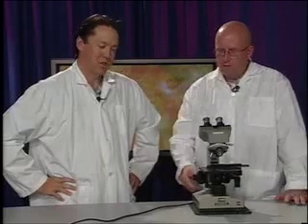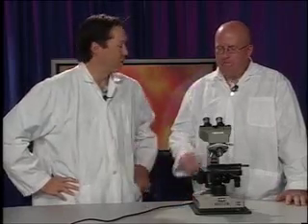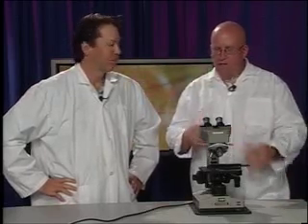So when I put a slide in there, I got to make sure I'm on low, focus, use my coarse one and my fine one, and then as soon as I go to medium, no more coarse, fine focus only. Fix it on medium, get to my focus, get my thing oriented in the right spot, go to high, focus again, take a look at what's there. For sure. Yeah. Normal.